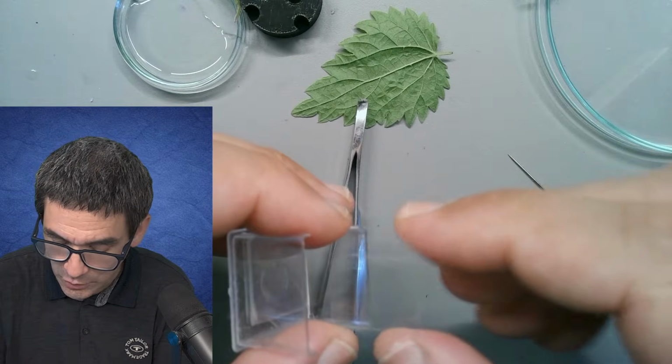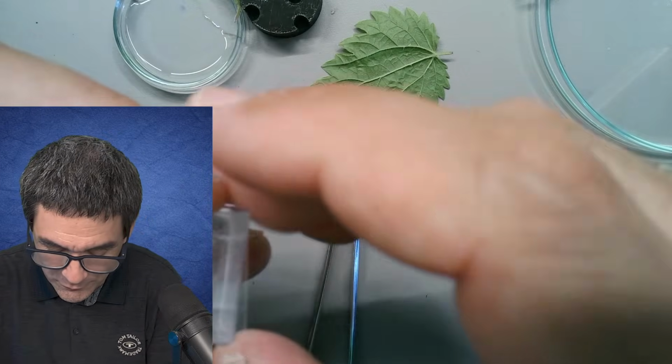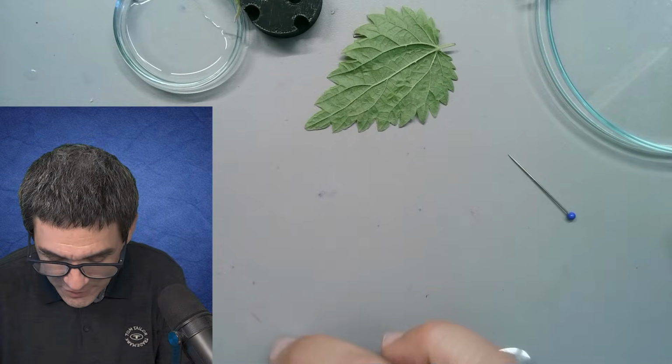It could maybe be that I also did not rinse those properly. Maybe there's even some dishwashing powder left on here. Not a good idea. It's bad for the microorganisms. Okay, yeah, exactly. Lime scale, it's called. This is calcium carbonate.